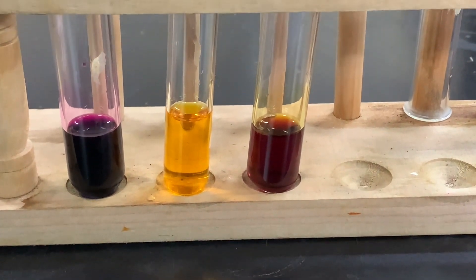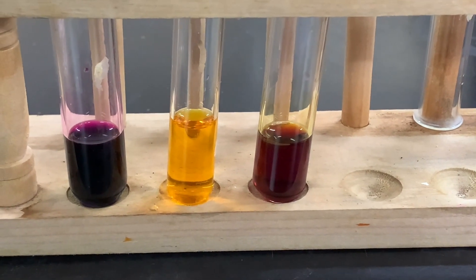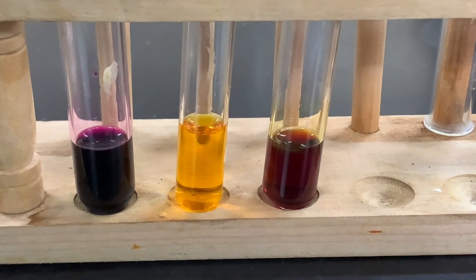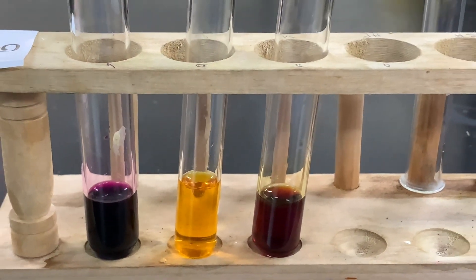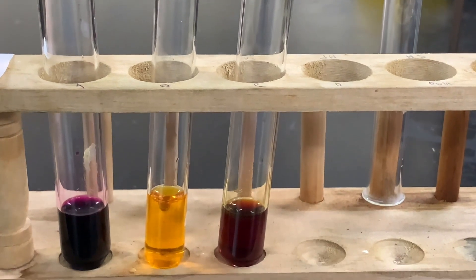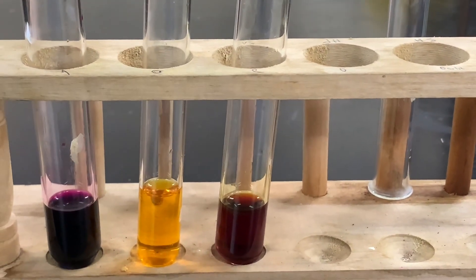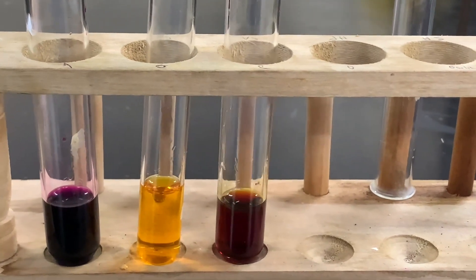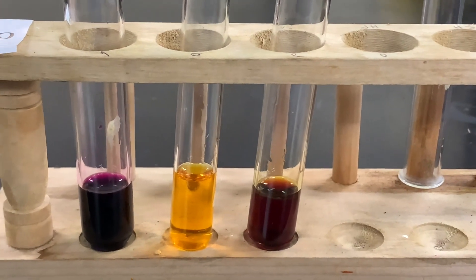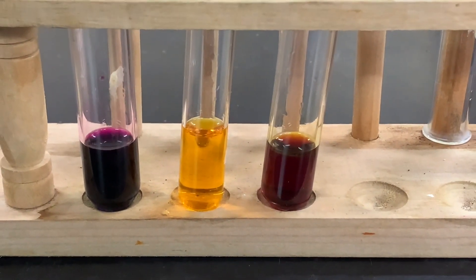It's very important to state if there is any change within our testing reagents. Our testing reagents are, again, acidified potassium manganate 7, which initially was purple; acidified potassium dichromate, which initially was orange; and acidified potassium iodide, which was a colorless liquid. This is what we've observed so far.